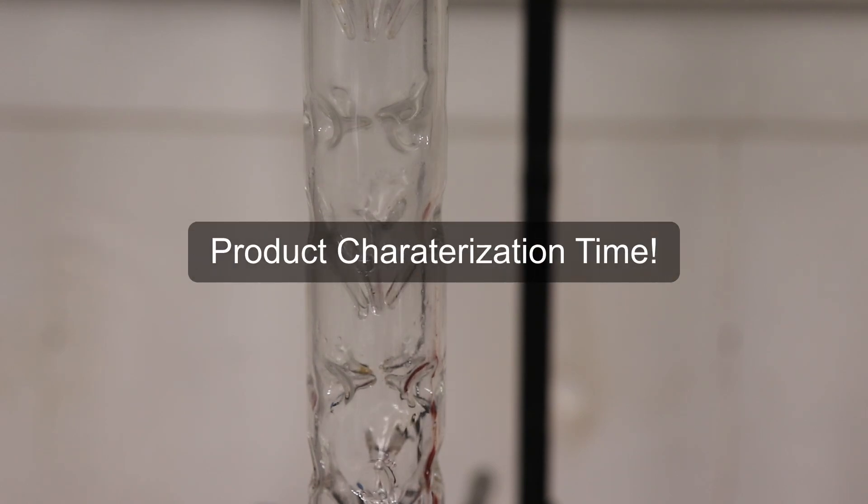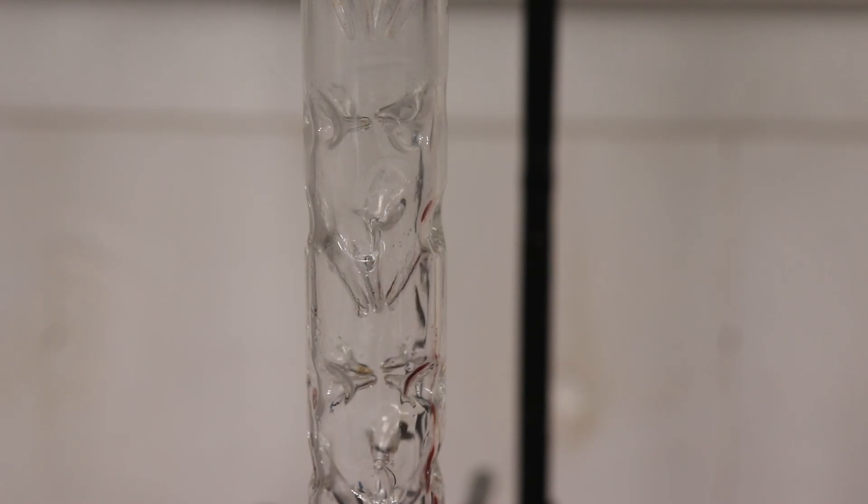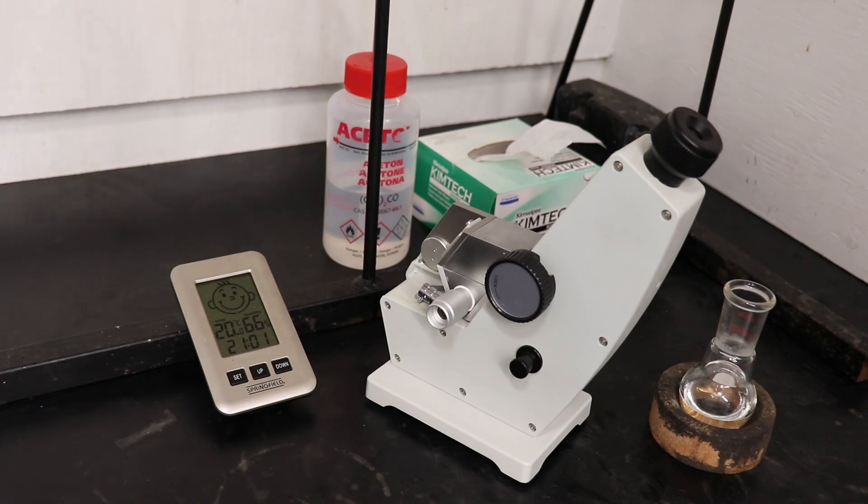Though in chemistry, characterizing your product is half the battle, and is a key part to the overall synthetic story. The first test I did was to measure the refractive index.